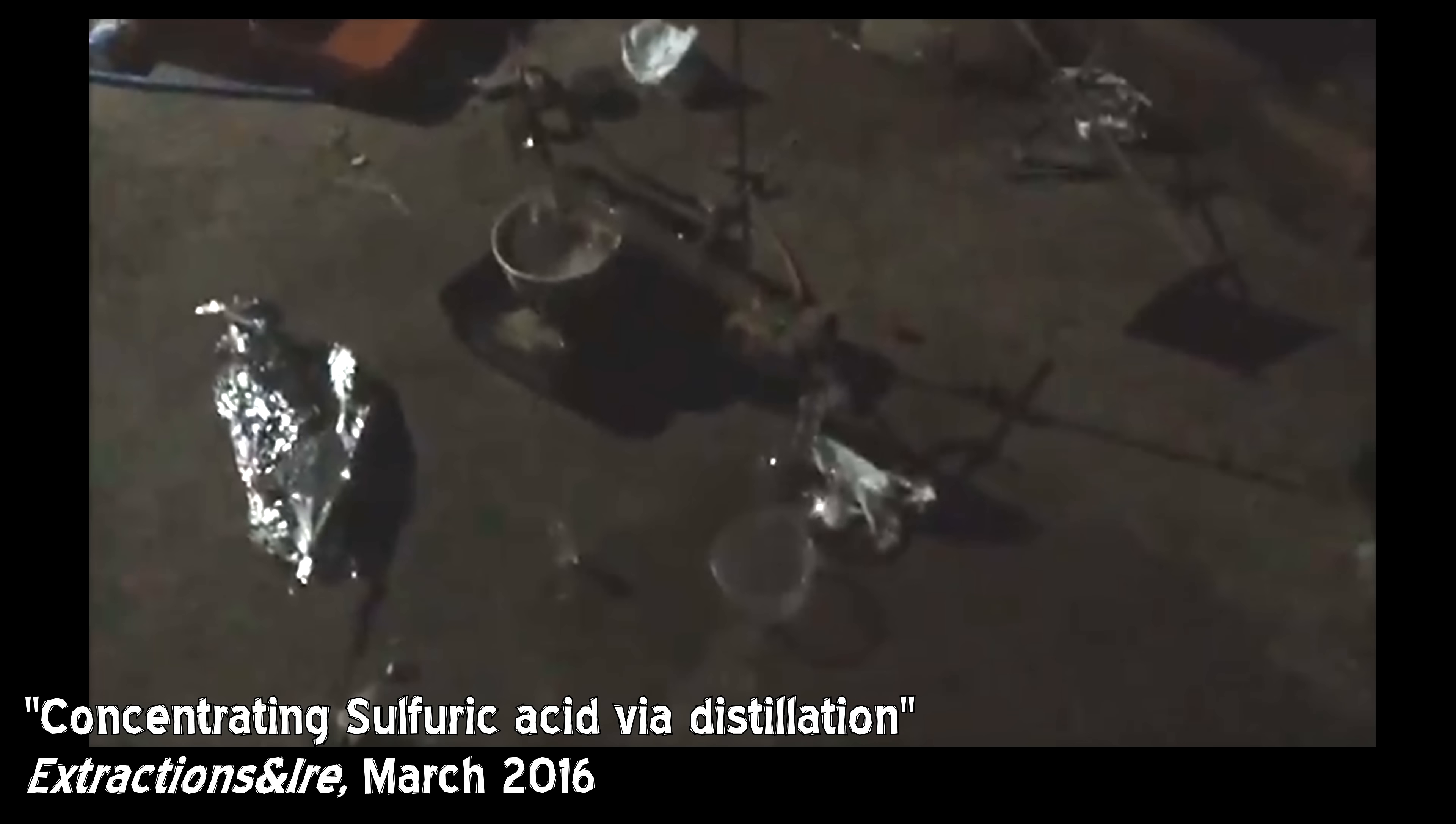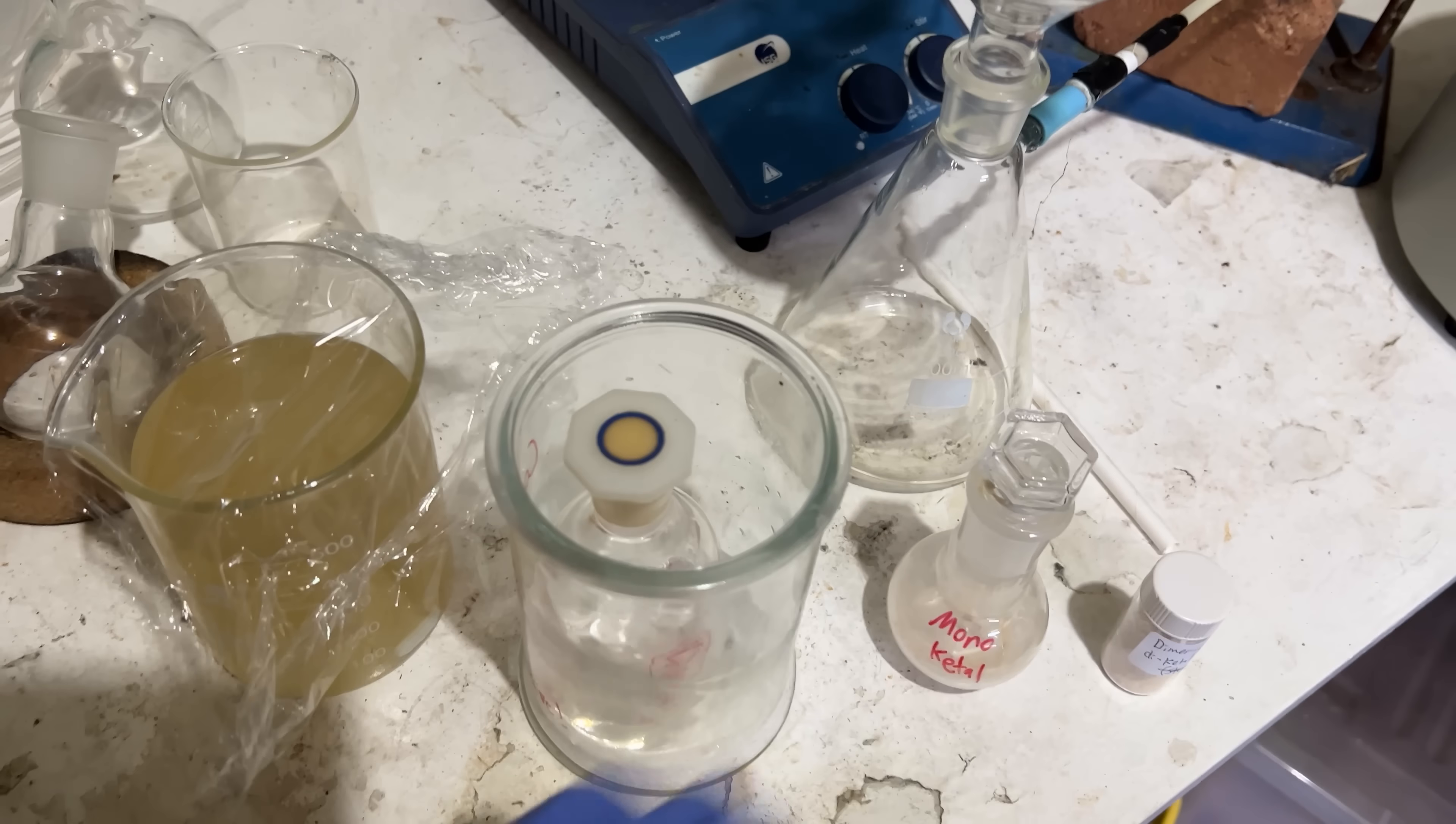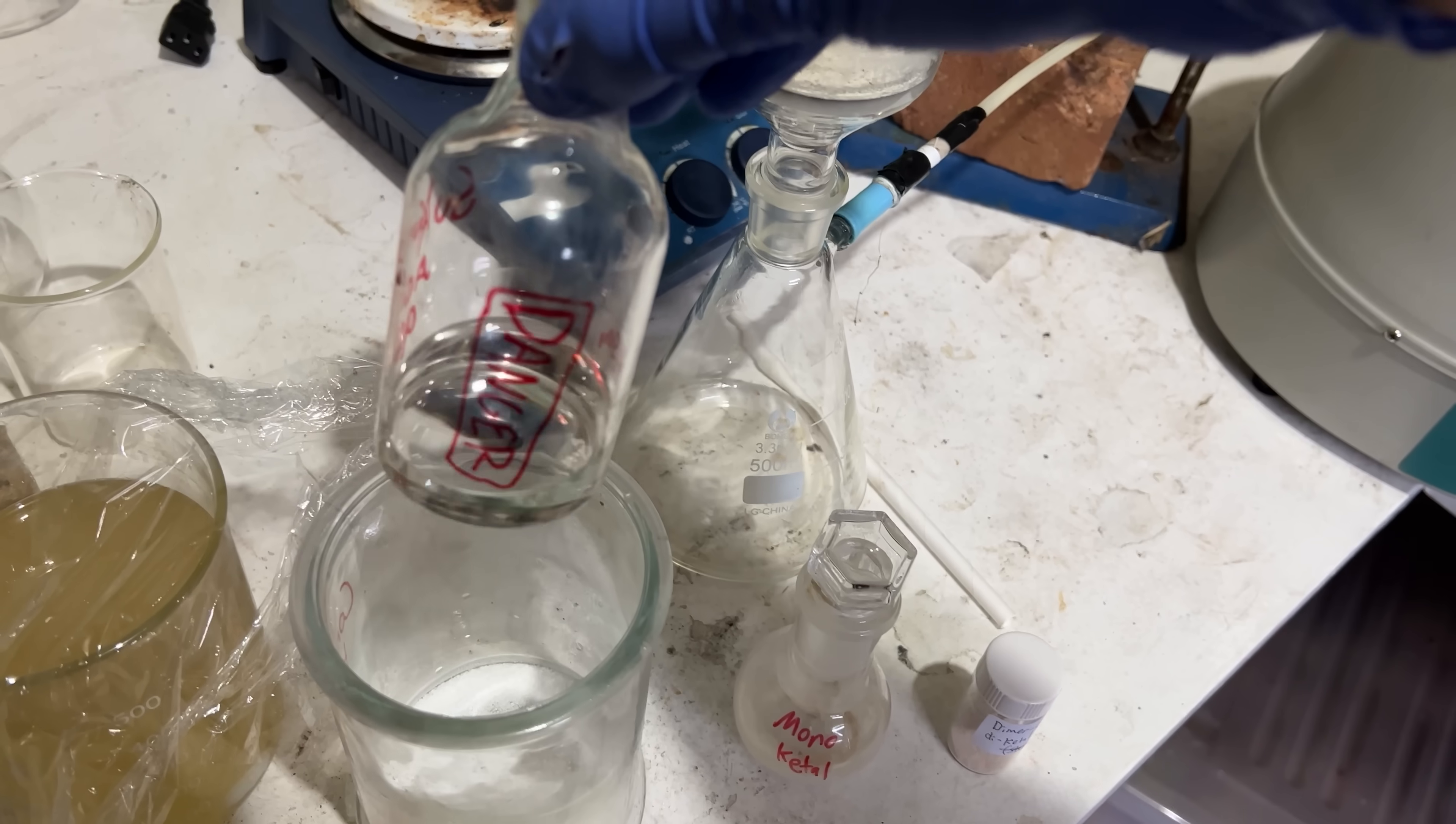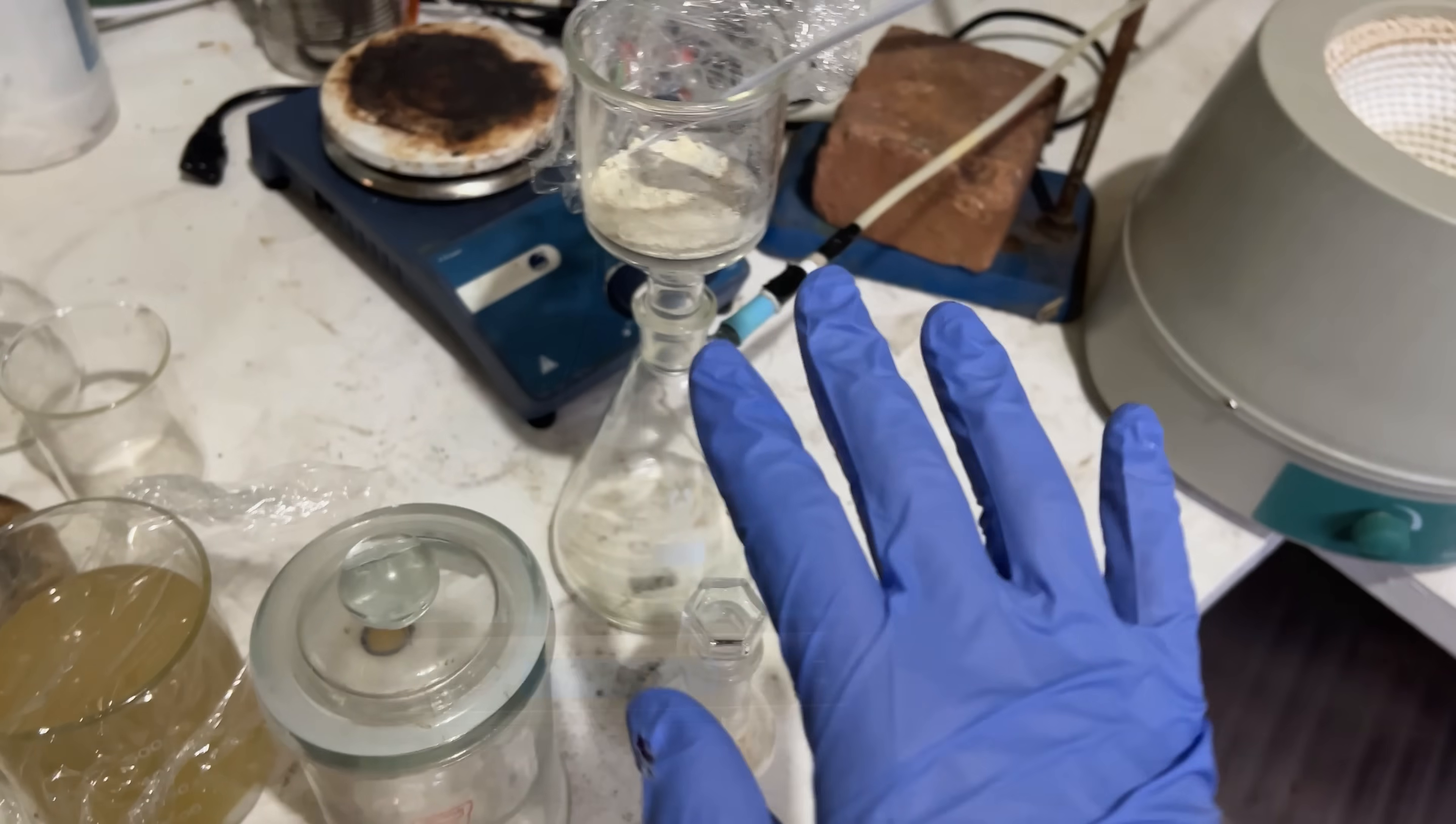Alright, so we're just about done, I've turned off the heating and the sulfuric acid stopped boiling pretty quickly, I'll just turn off this. You can see it's nice and clear, clear and thick, just how I like it, you know. Great, fantastic, let's get to doing that.